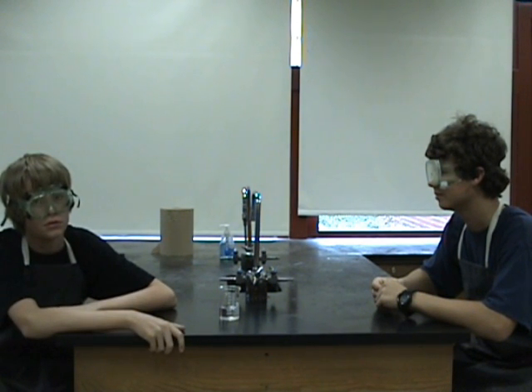If you wish to see the results of the mixing of two chemicals, ask the teacher. Mr. Jordan, are we allowed to mix sodium hydroxide and hydrochloric acid? As long as you follow safety procedures.